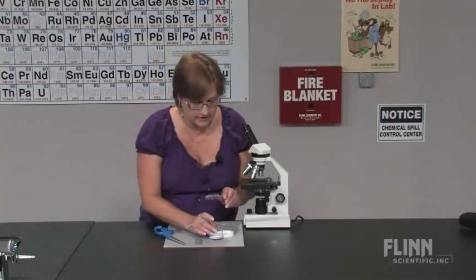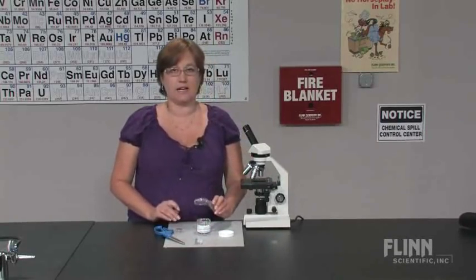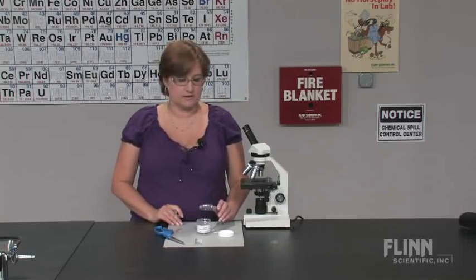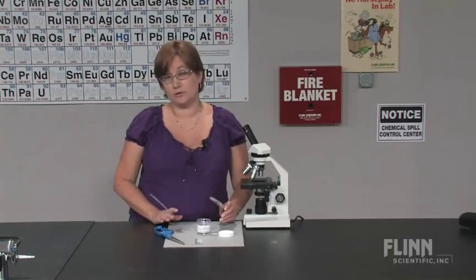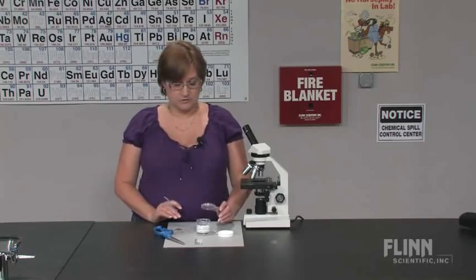They are visible with the naked eye, but I find the use of a hand lens or a stereomicroscope assists in finding them, especially for students. You don't want it to be too frustrating for them.